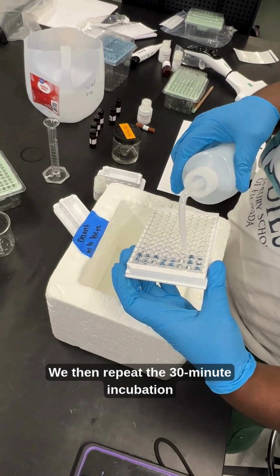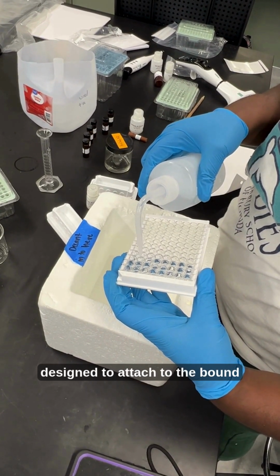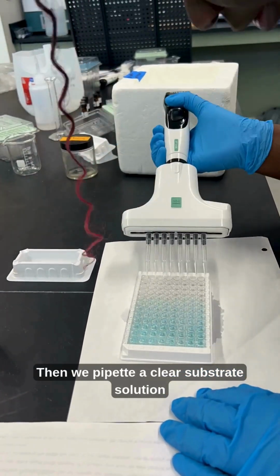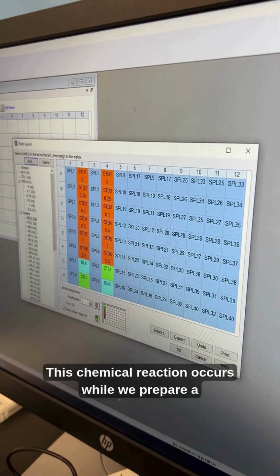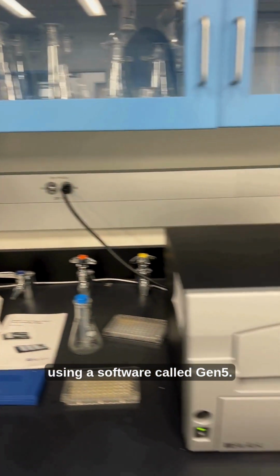We then repeat the 30-minute incubation with a separate antibody designed to attach to the bound brevetoxin and make it detectable. Then we pipette a clear substrate solution that indicates the presence of brevetoxin by turning blue. This chemical reaction occurs while we prepare a computer to run the assay using a software called Gen 5.